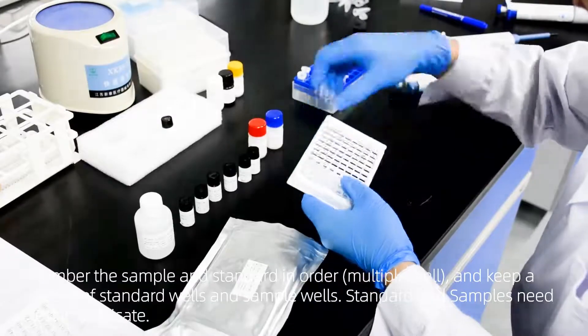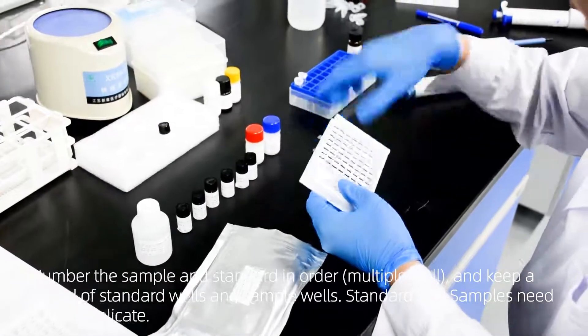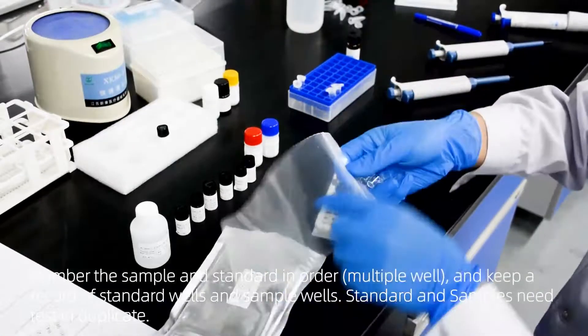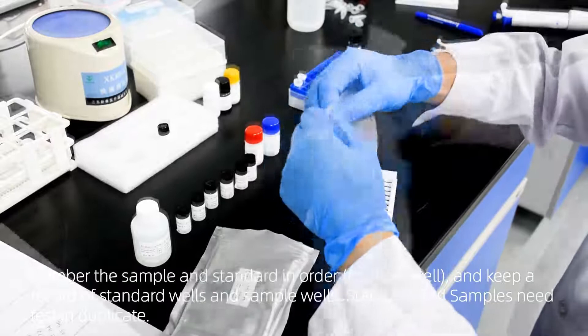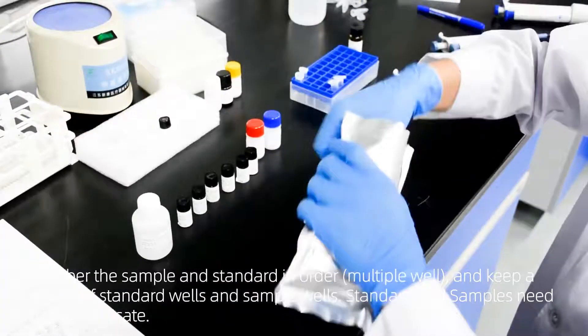Number the sample and standard in order on the microwell plate and keep record of standard wells and sample wells. Samples need to be tested in duplicate.